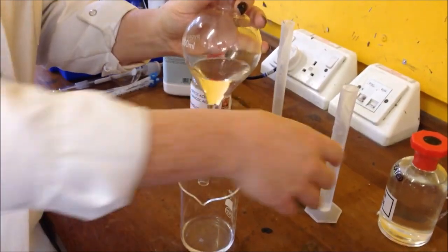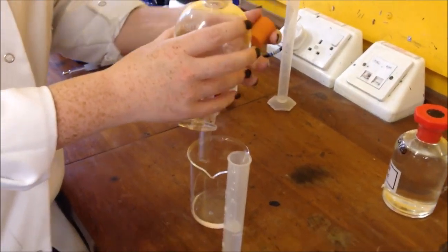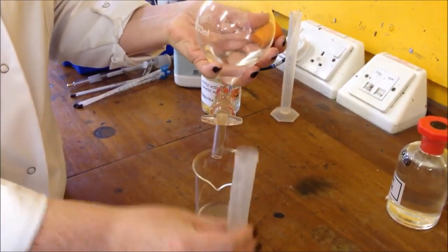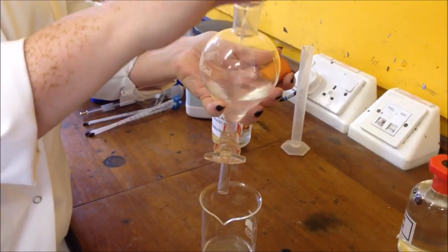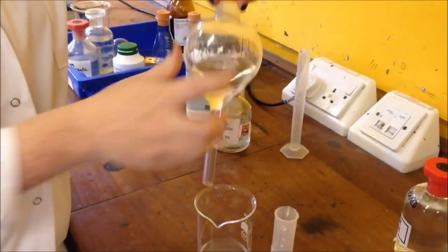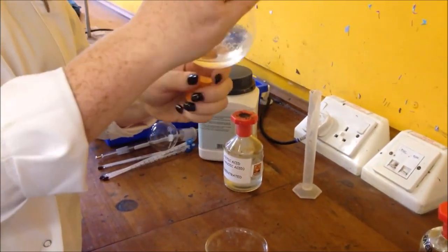So now that I've done that once I need to do that again with 20 cm³ of saturated calcium chloride. So my stopper is closed and this is the top layer from before. So in that goes. Again I need to mix it. Pop that in there, make sure it's a secure grip. Mix it a couple of times.